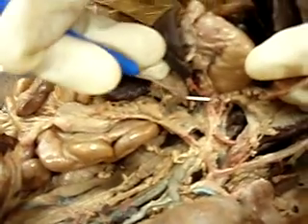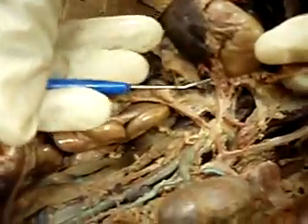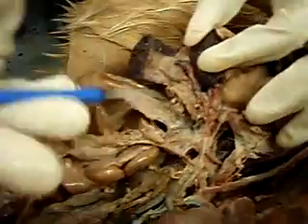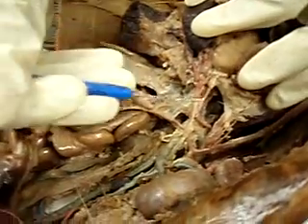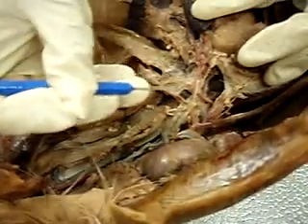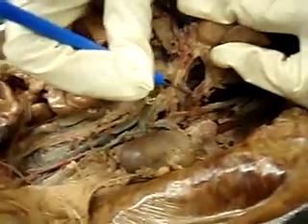This is like one. This one is the hepatic artery. The next one is gastric artery. It connects to the stomach, gastric. And then this is the splenic. This is the spleen. I can pull it out right here. This whole artery is the splenic artery because it goes to the spleen over here. Splenic artery. So celiac trunk, splenic artery, gastric artery, hepatic artery.